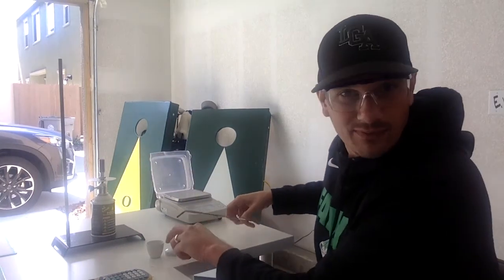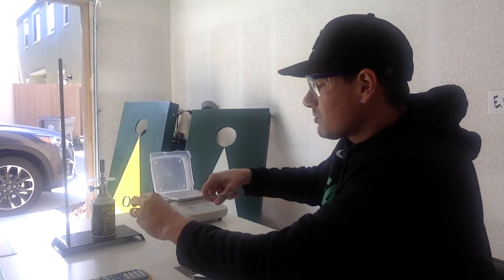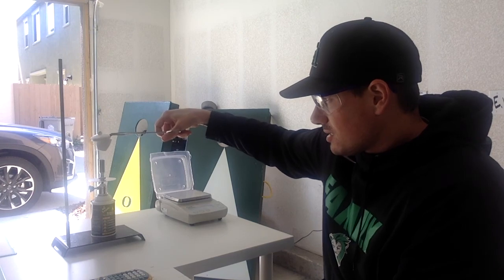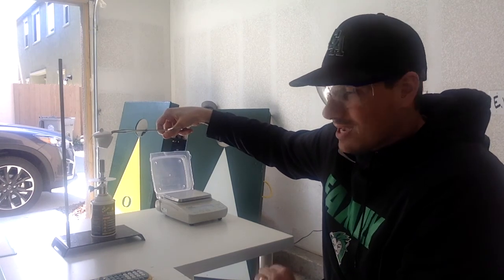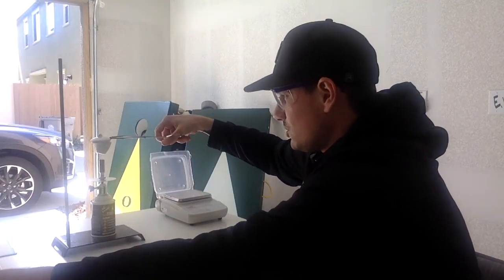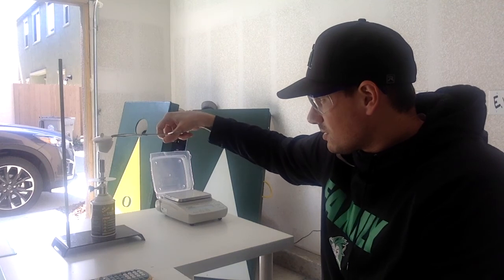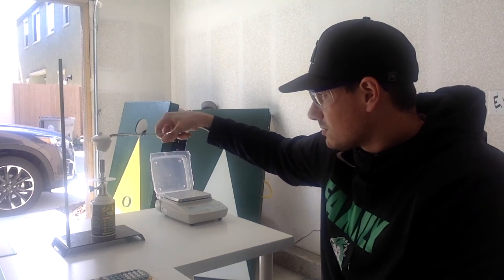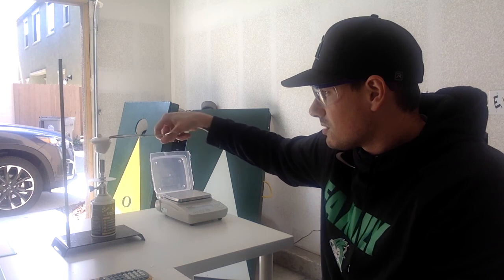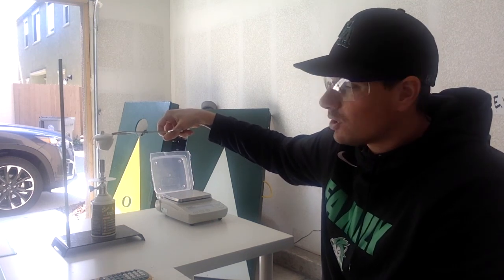Now, you can't see the flame there, but woo, it's going to be hot. So I'm going to put this right over it, and hopefully this thing will light on fire. If not, I have my handy dandy blowtorch that I can torch this thing. Okay? Once it heats up, it's going to start going.